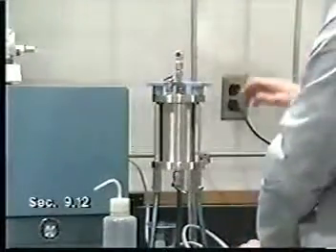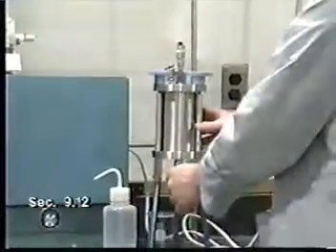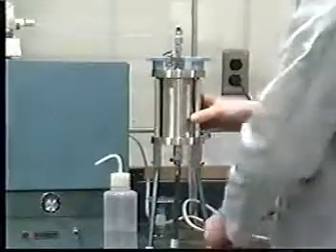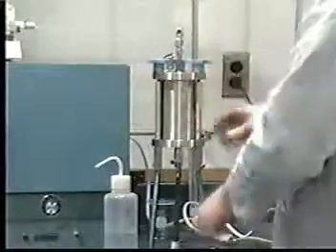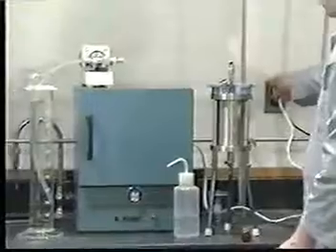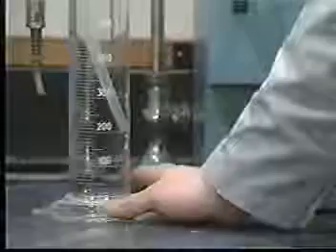The line shall be pre-flushed with fresh fluid to eliminate air bubbles. Release pressure at the gas inlet-outlet valve. Open the liquid inlet-outlet valve to add fluid to the ZHE using a direct transfer pump or similar means. Continue pumping fluid until the correct amount has been transferred.